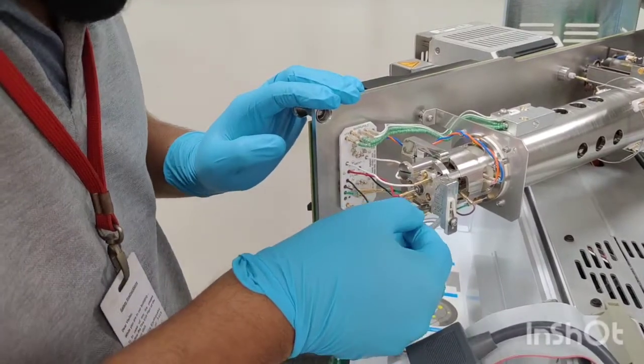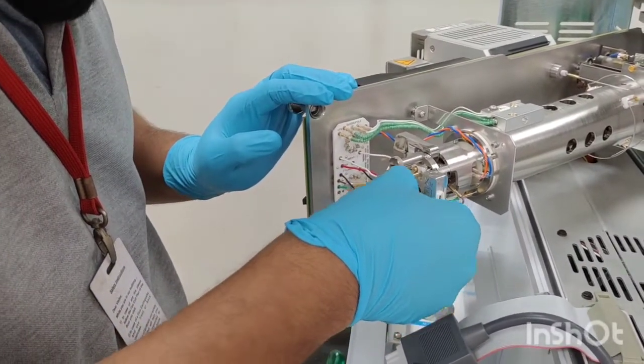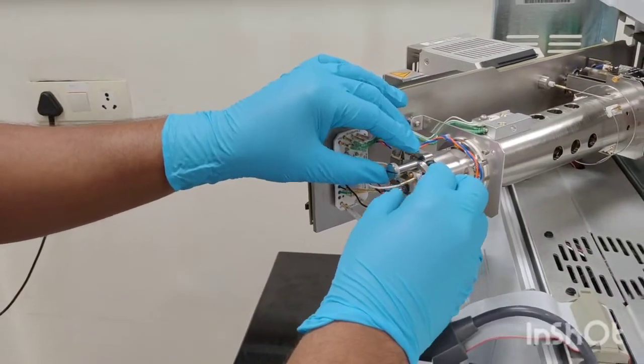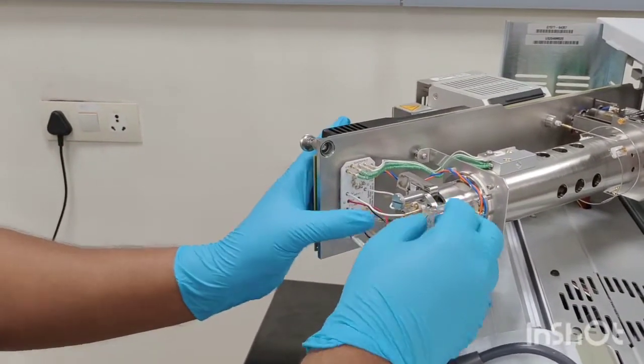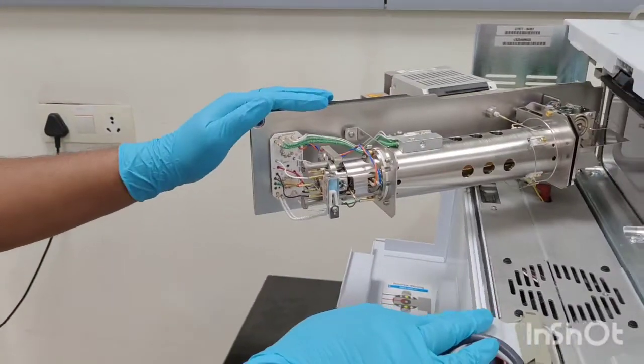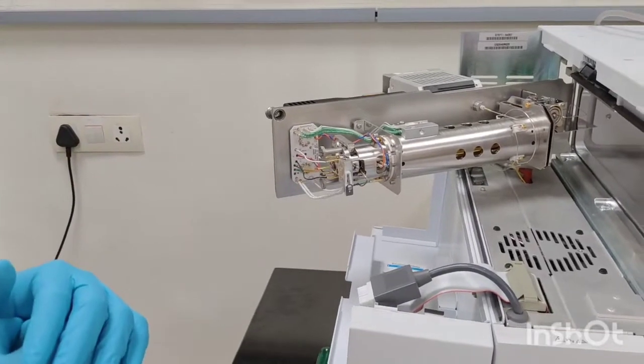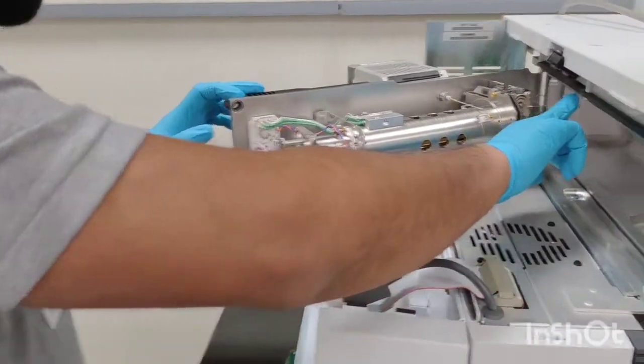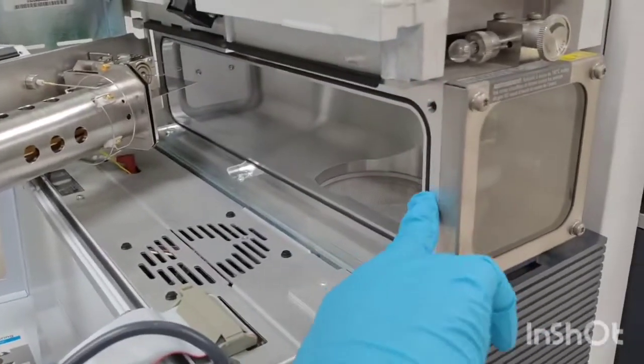So we have fixed the filament number two cables also. Just check all the cables are fixed properly, no cable is loose. When you have confirmed that everything is fine, while restarting the MS and you have opened this portion already, you can also check this O-ring.